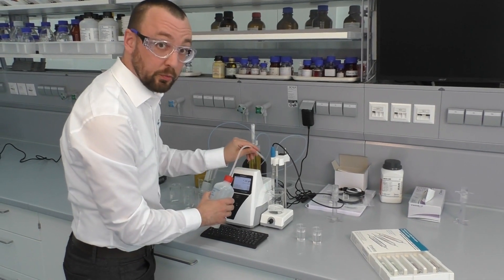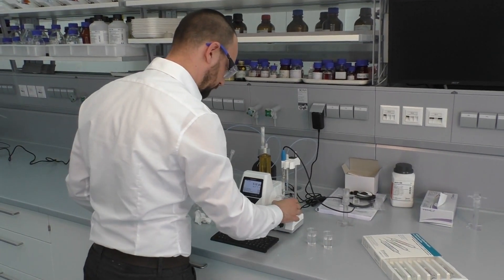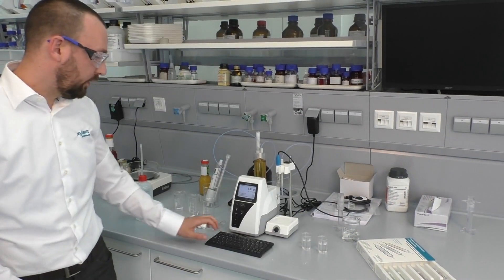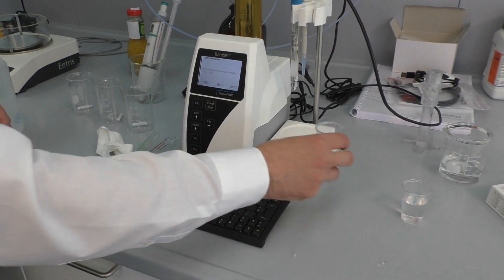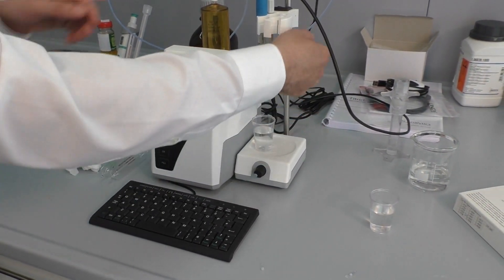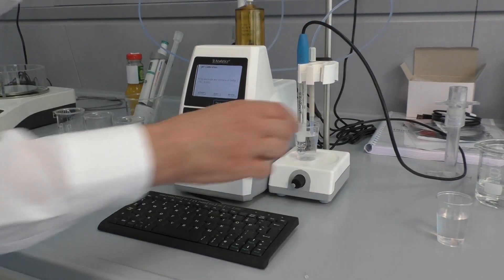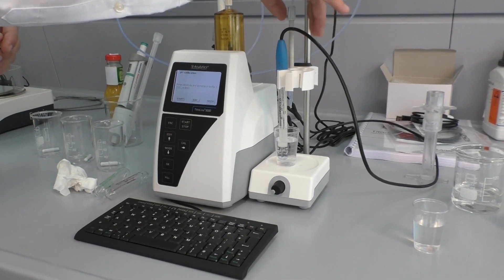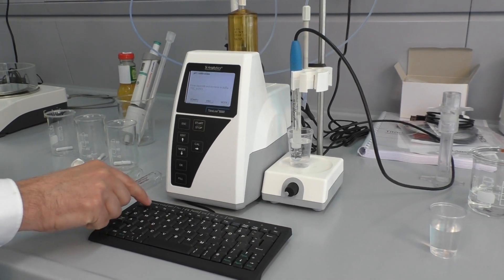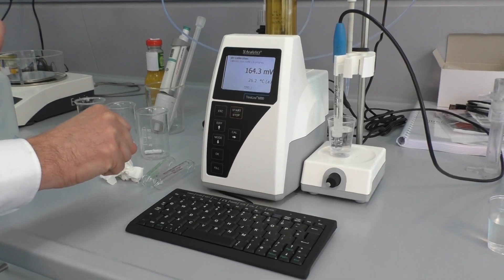The pH electrode is rinsed before the calibration is started with deionized water. Then we go with F8 to the calibration menu of the instrument. The display says automatically which step needs to be performed — in that case, rinse electrode, which we have already done, and immerse into buffer 1, which is the pH 4 buffer. Then we press the start button and the calibration is performed.